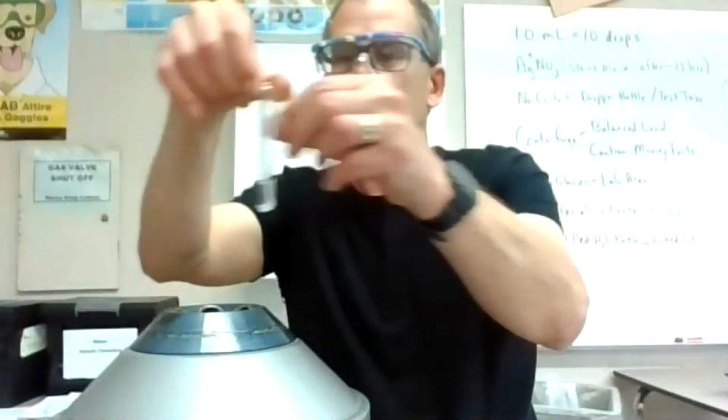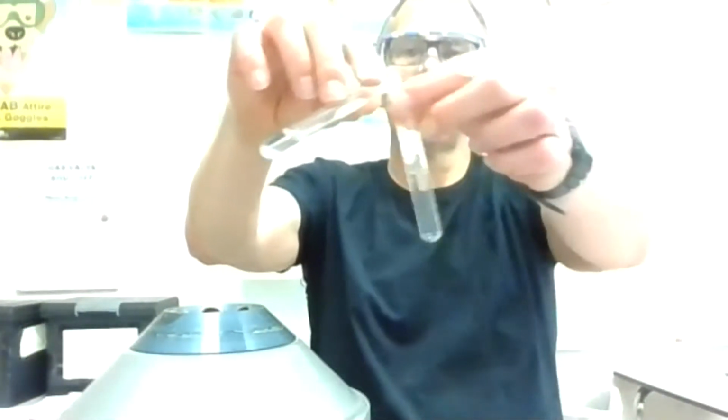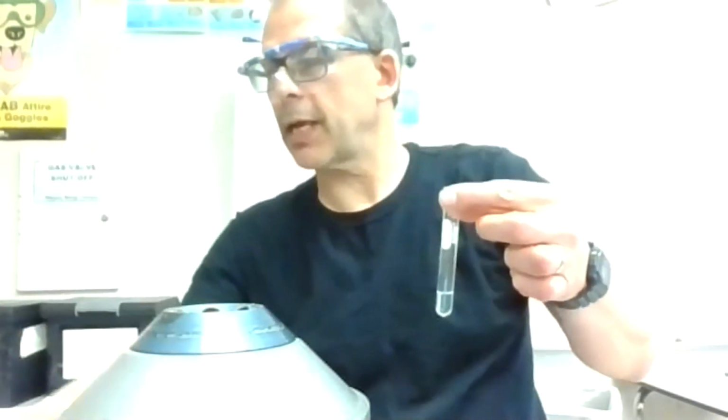Notice this is a blank with just, oh, that's actually something from the last lab. It looks clear, but there's some solid at the bottom, and that looks kind of fluffy from my view. We're going to leave the precipitate behind. I'm going to pour that into a new test tube and essentially decant the liquid. It looks like a nice clean liquid with the solid left behind, and then I can do my next test on this liquid.